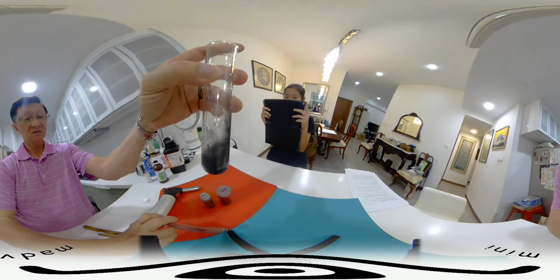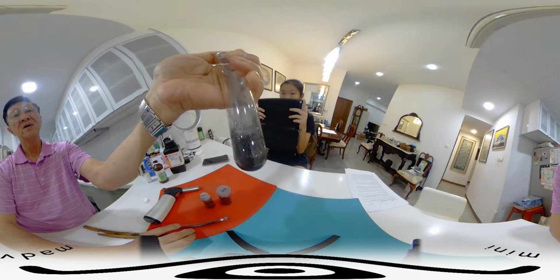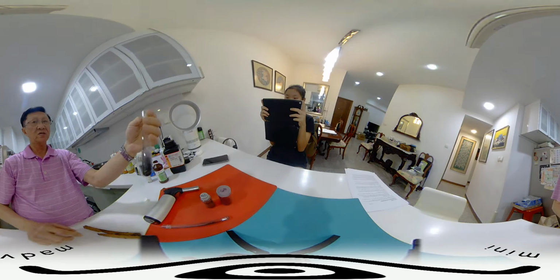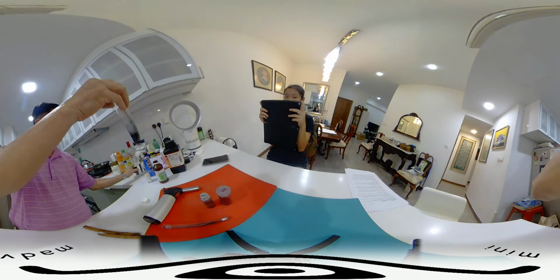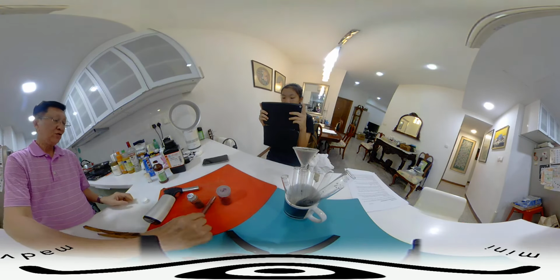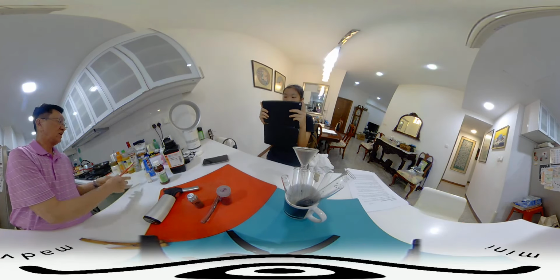there is no effervescence coming out, or rather there is very little gas coming out. There is a little bit of gas, but very little. However, if we put MnO2, this one, inside there, you find that there will be a lot of oxygen gas that will come out.